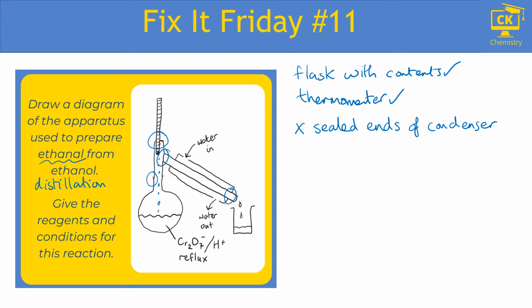Okay, what else is the problem? Well, we talked about a round bottom flask or a pear-shaped flask being important to distribute heat. The source of heat has not been drawn, or there's been no reference to heat in this diagram. So reference to heat can be as simple as an arrow underneath with the word heat. There is no requirement to draw a Bunsen burner. In fact, it's not good practice to use a Bunsen burner for this because aldehydes and alcohols are extremely flammable. So probably we would rather have a water bath or an electric heater, but you don't really need to be able to draw those. So you can just simply do an arrow and the word heat, but it needs to be in there because it's part of the experimental setup.